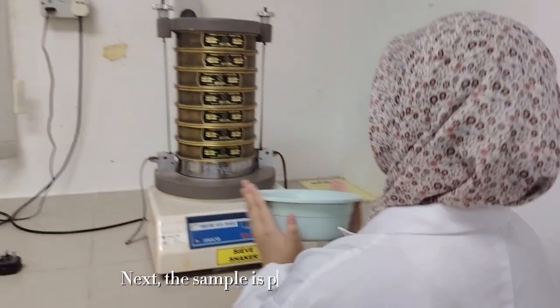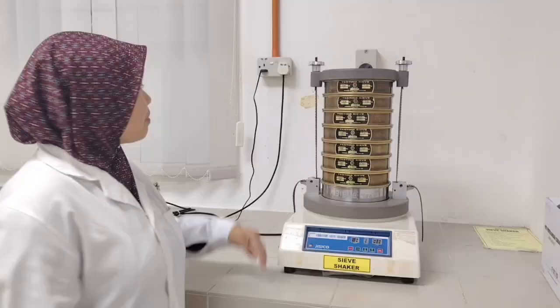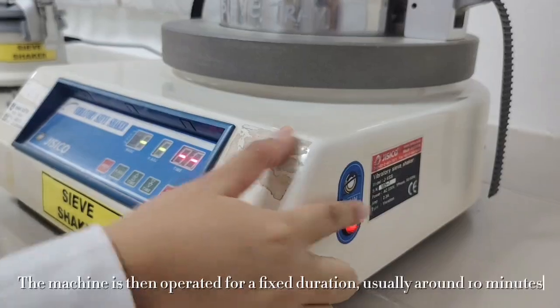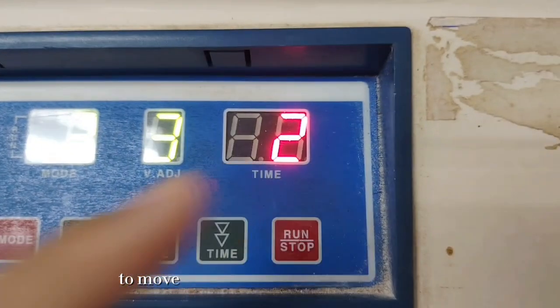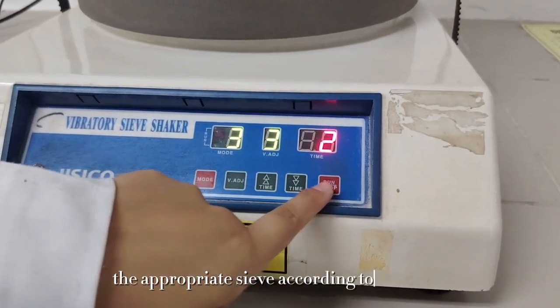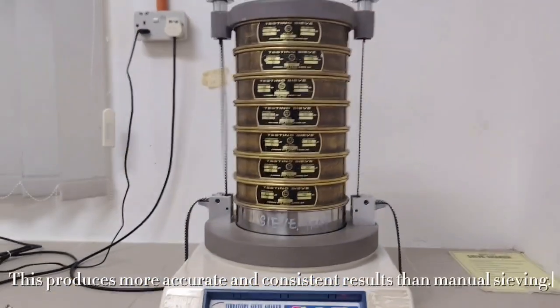Next, the sample is placed on the top sieve and the sieve stack is secured onto the sieve shaker. The machine is then operated for a fixed duration, usually around 10 minutes. During this process, the shaker vibrates continuously, allowing the particles to move across the mesh and pass through the appropriate sieve according to their size. This produces more accurate and consistent results than manual sieving.